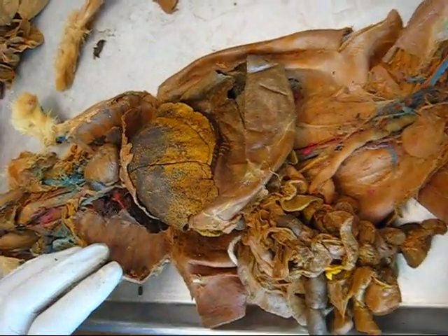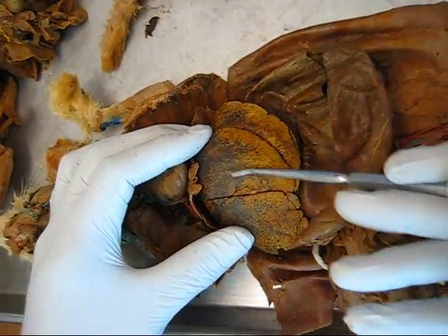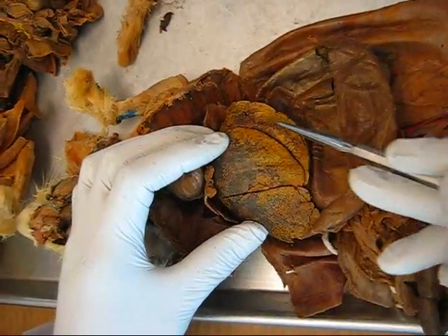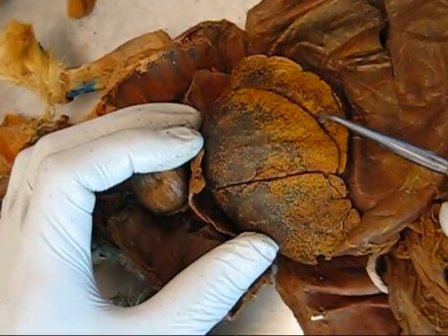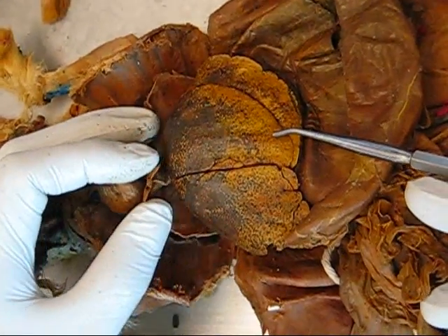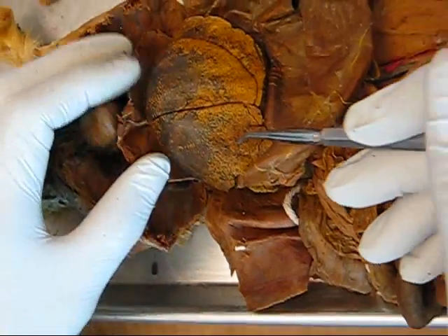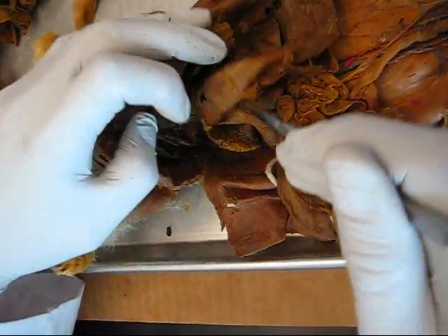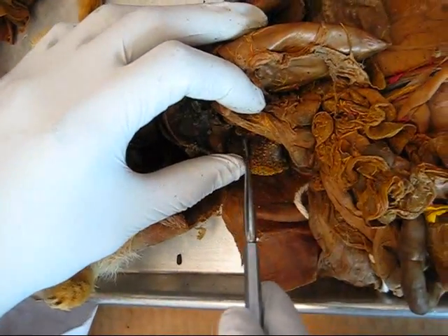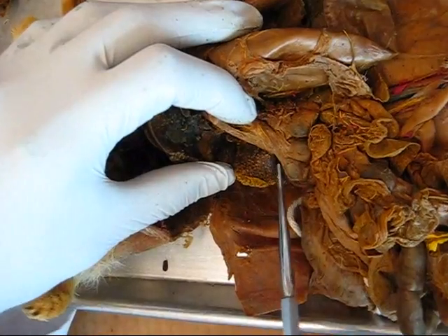Abdominal organs. Here we have the liver. Left lateral lobe, left medial lobe, right medial lobe. Right lateral lobe — here we have the anterior portion.